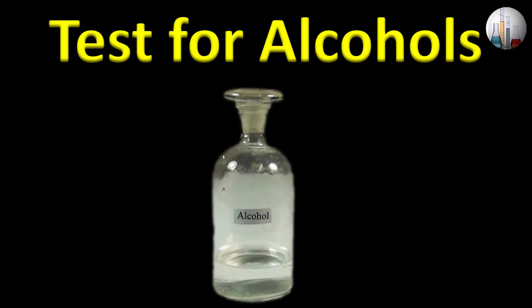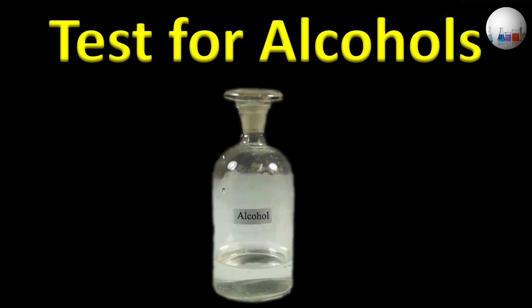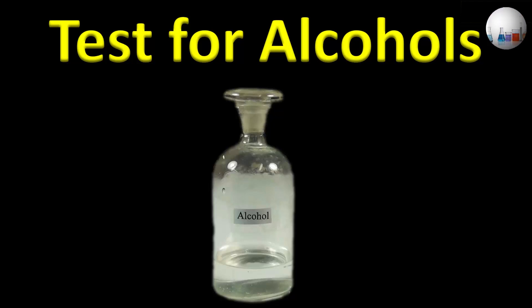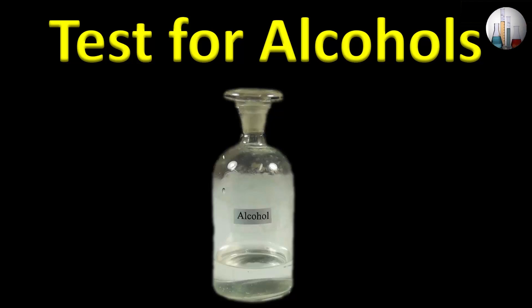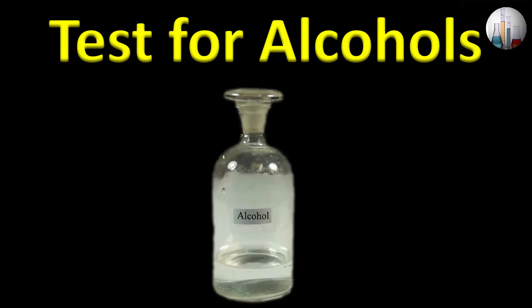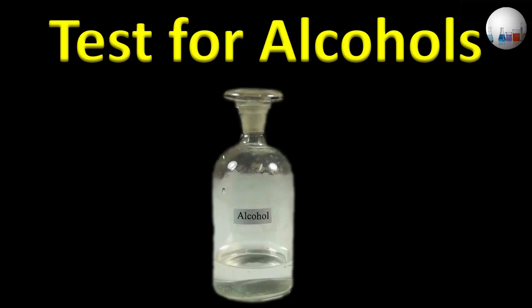Hello and welcome to this video series. In this series, we will be presenting various experiments in chemistry. In this particular video, we will be explaining and demonstrating for you some simple tests for alcohols.